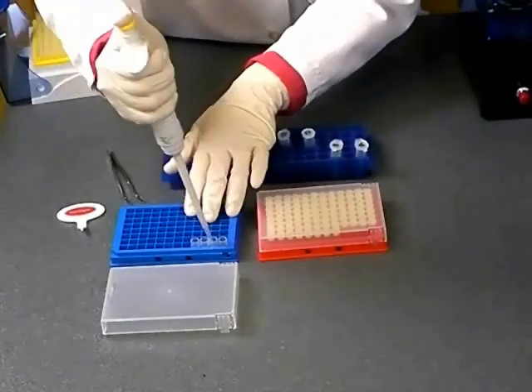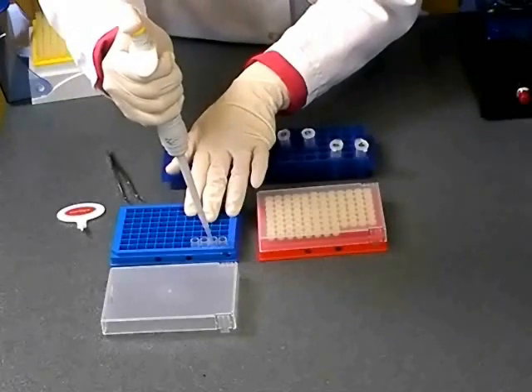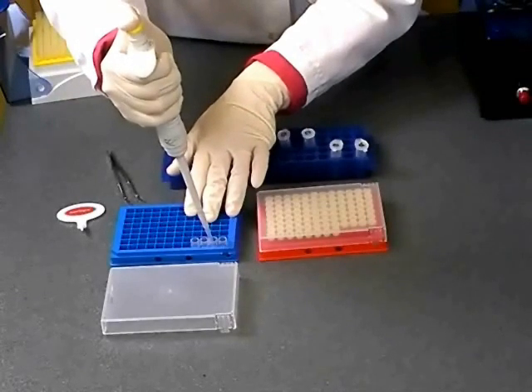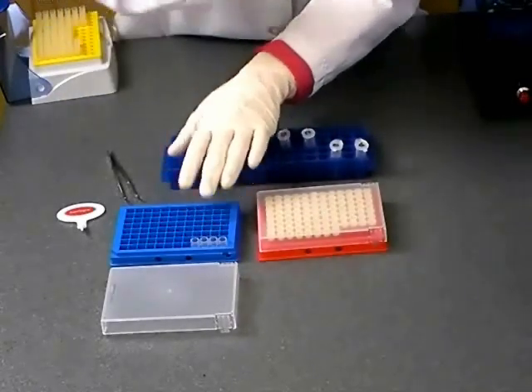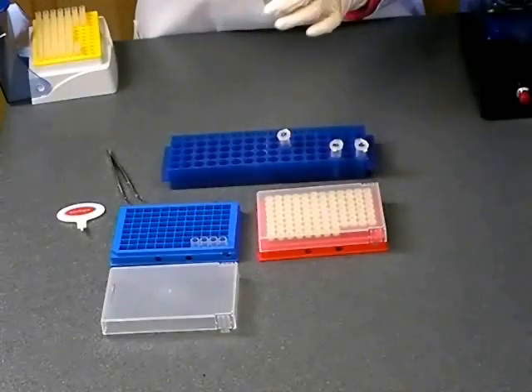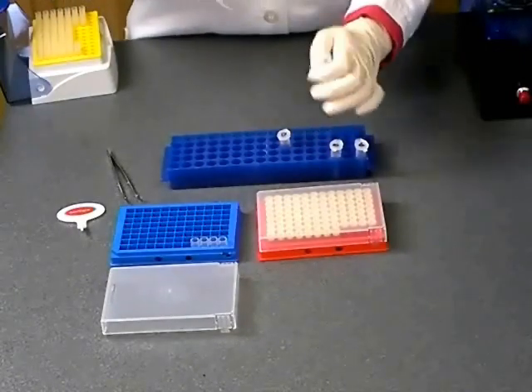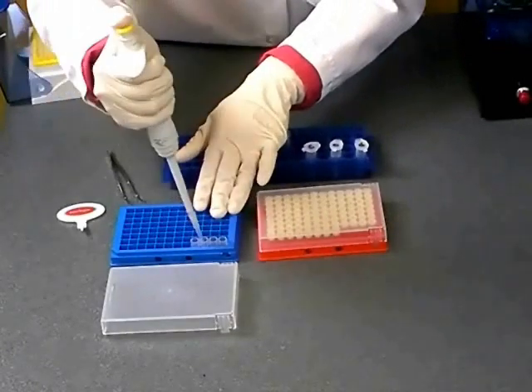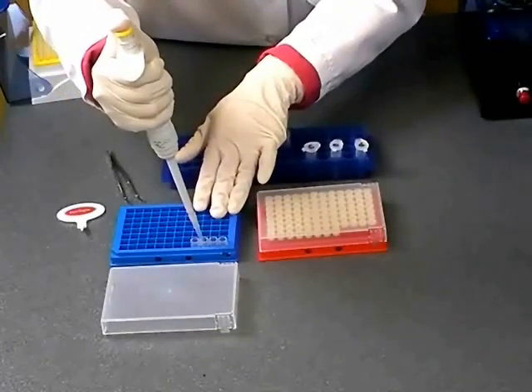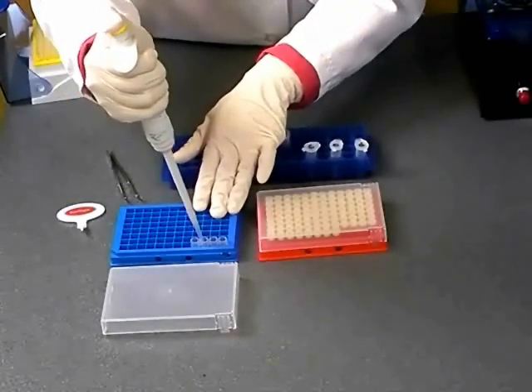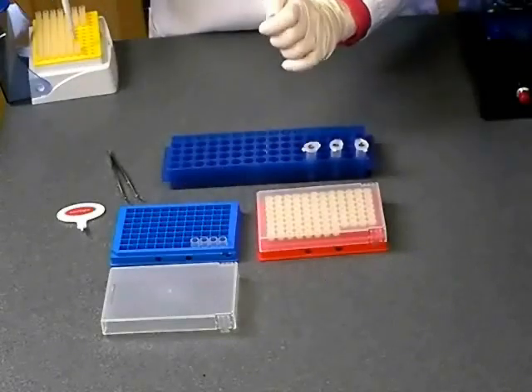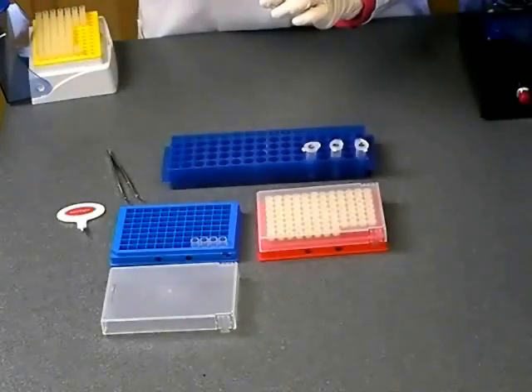Repeat this process as desired until all of your DNA samples have been added to Gentegra tubes. As a reminder, each Gentegra tube has the capacity to store 50 nanograms to 5 micrograms of DNA. Masses above 5 micrograms should be stored in two Gentegra aliquots.